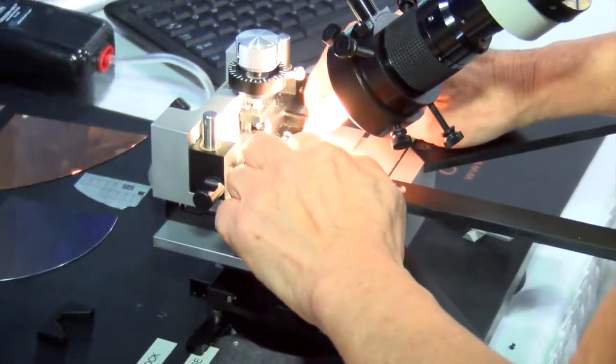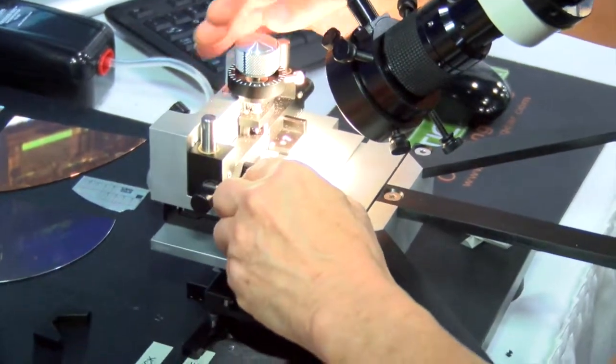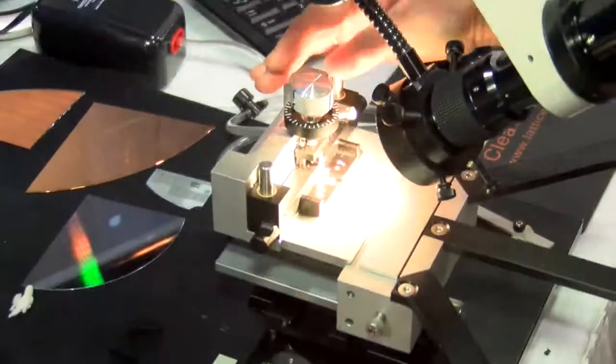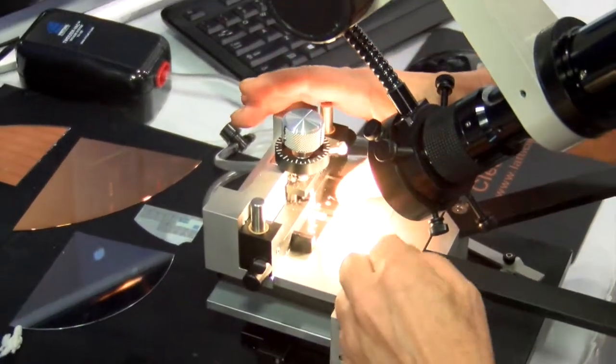Placing the hold downs with the sample on the LatticeX, viewing it with the high accuracy vision. Once the sample is ready we select the target.